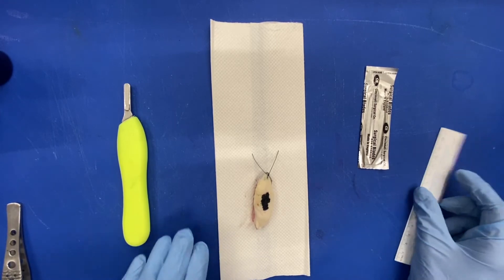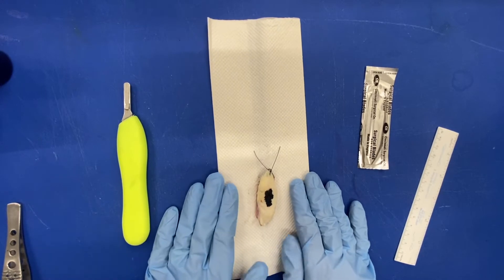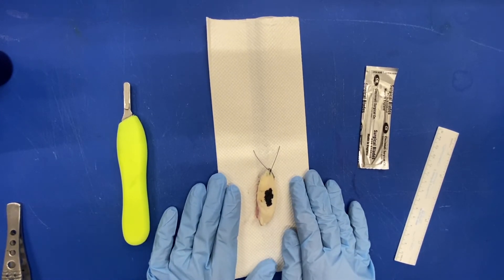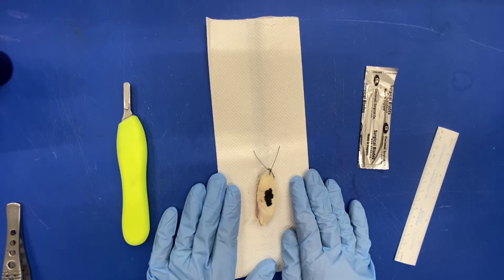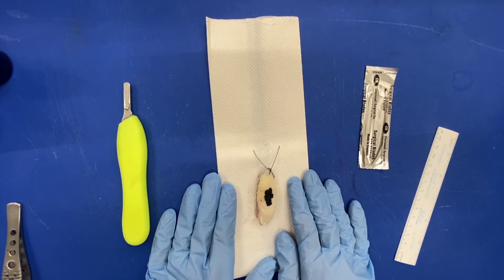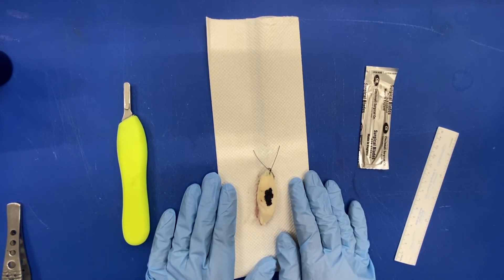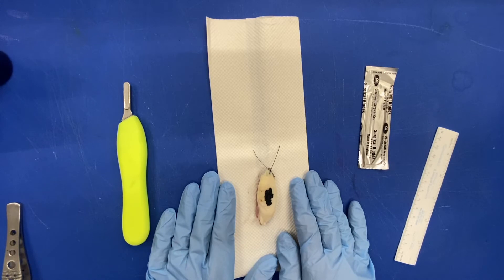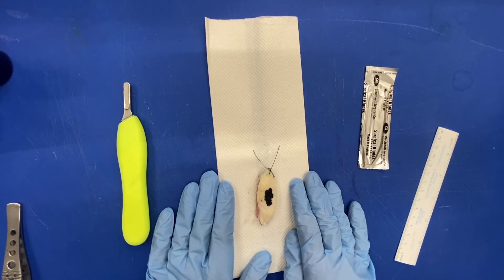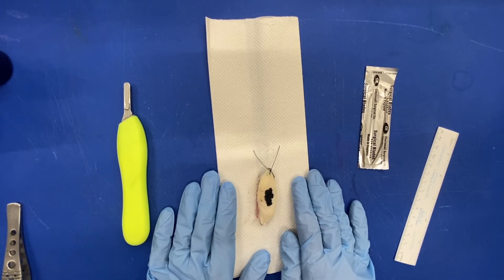After those initial measurements, to recap: check the orientation, then measure the skin in length and width and then the depth of the specimen. Then you'll measure the lesion in two dimensions on the skin surface. The third dimension will be obtained upon serial sectioning. Now I'm going to ink — we ink oriented skin ellipses two colors.